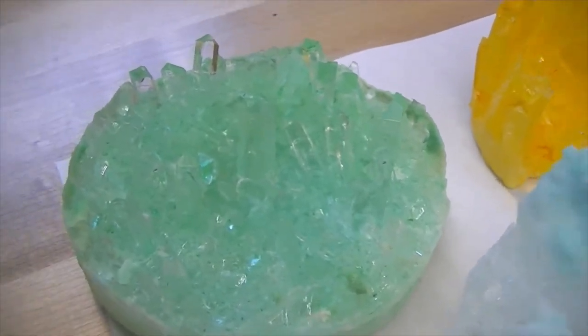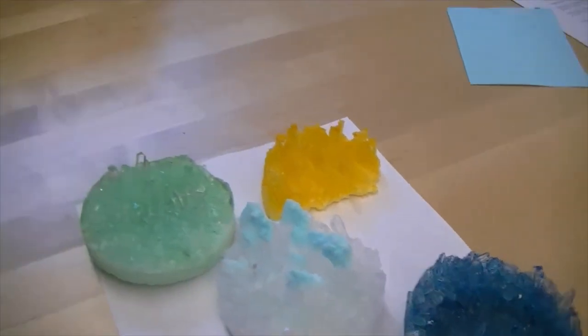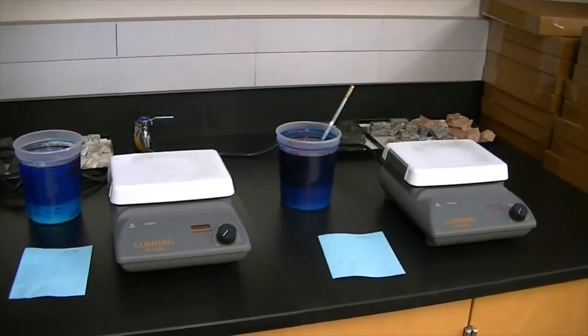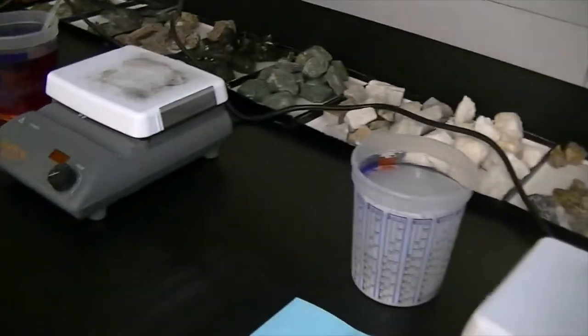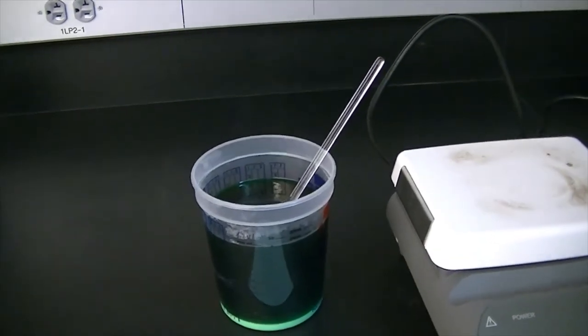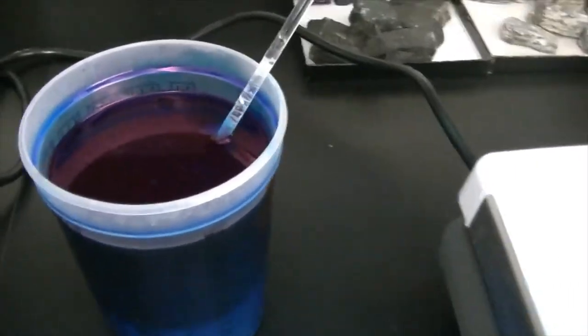This green sample used considerably less food coloring, so we can write a hypothesis: greater concentrations of food coloring will result in finer or smaller crystals. Another hypothesis could be that large concentrations of ammonium phosphate are going to grow larger crystals, or that smaller amounts of ammonium phosphate are going to grow larger crystals. The sample starting at 300 milliliters: we can write that smaller concentrations of ammonium phosphate will result in smaller crystals, while the larger concentration at 500 milliliters will result in larger or more numerous crystals.